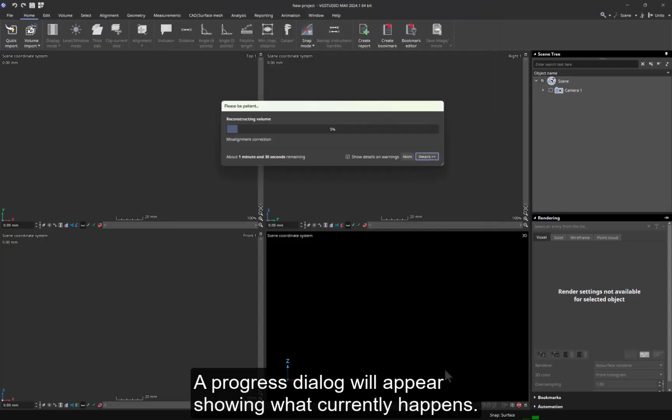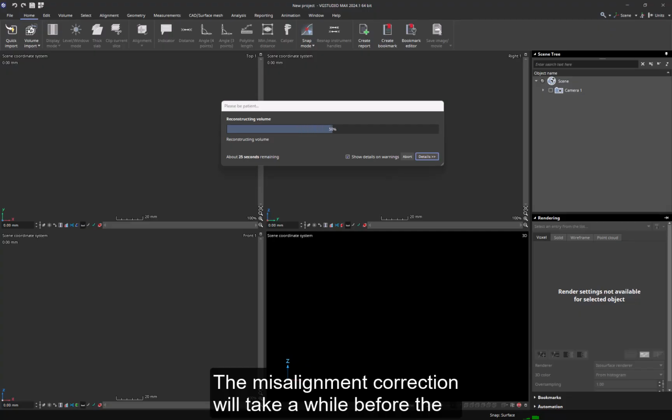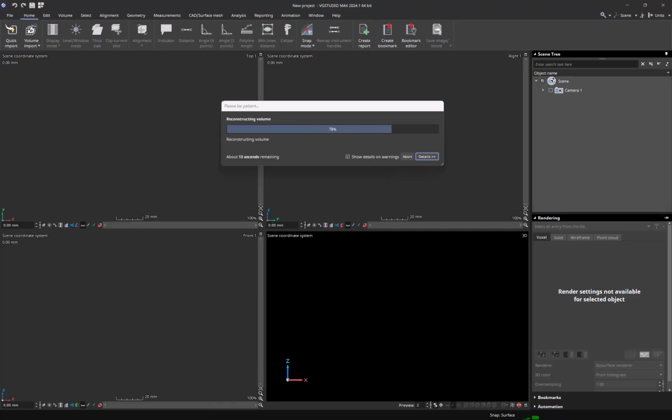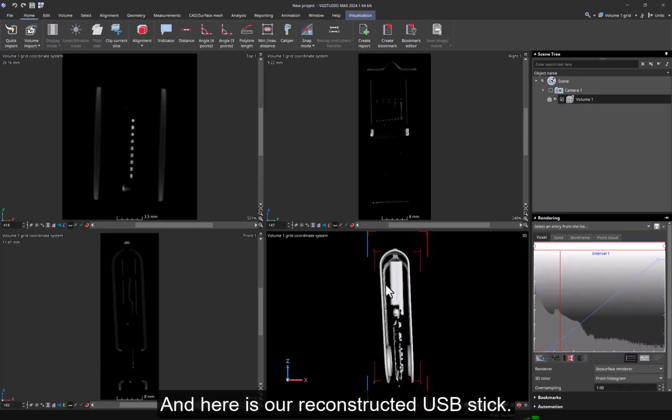A progress dialog will appear showing what currently happens. The misalignment correction will take a while before the actual reconstruction starts. And here is our reconstructed USB stick.